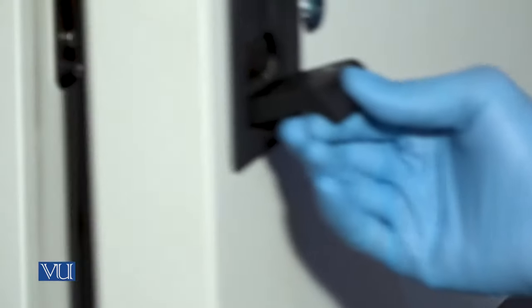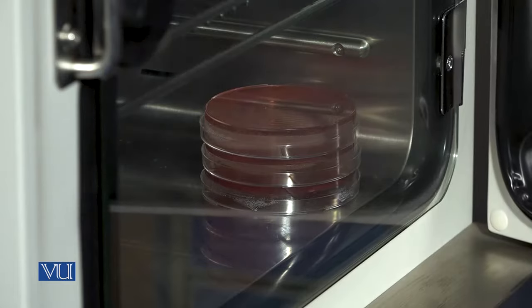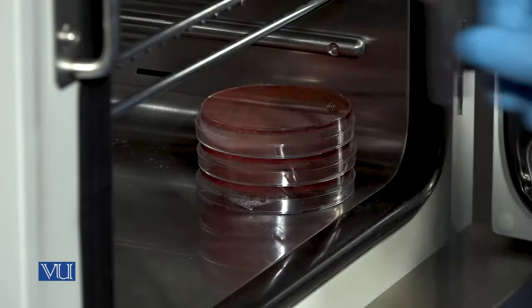After 12 to 24 hours of incubation, take out the petri plates to check bacterial growth.